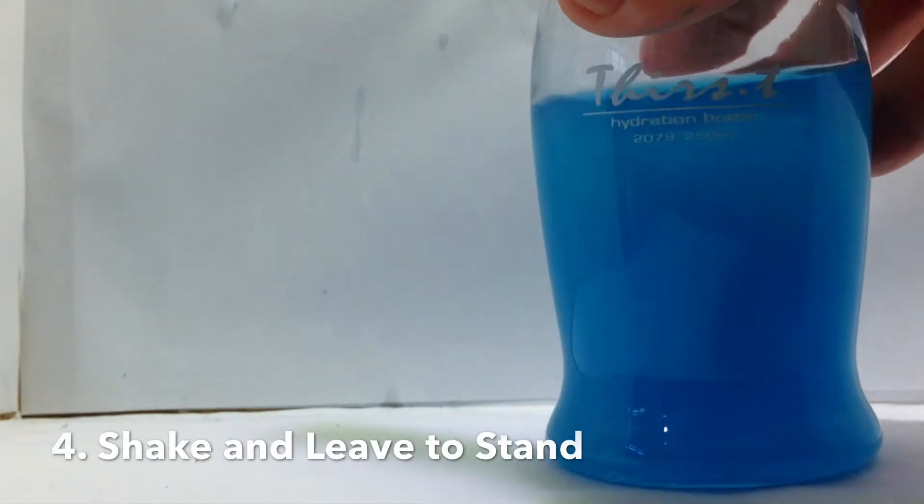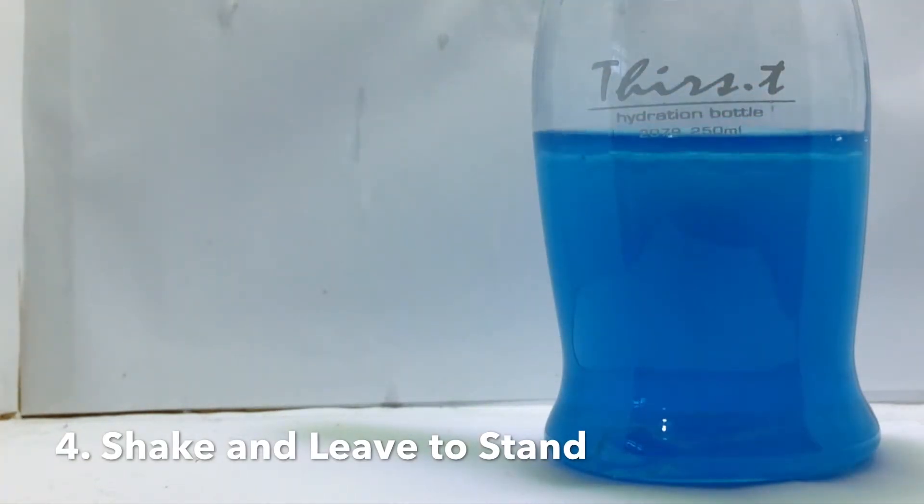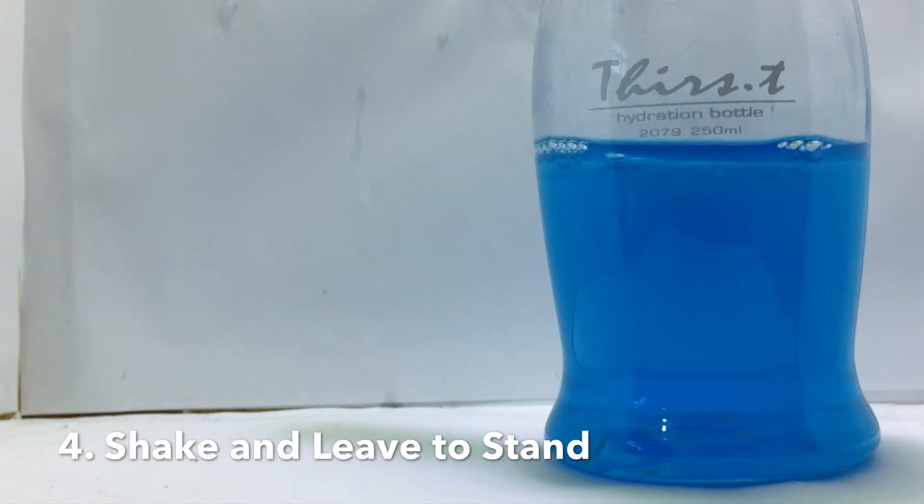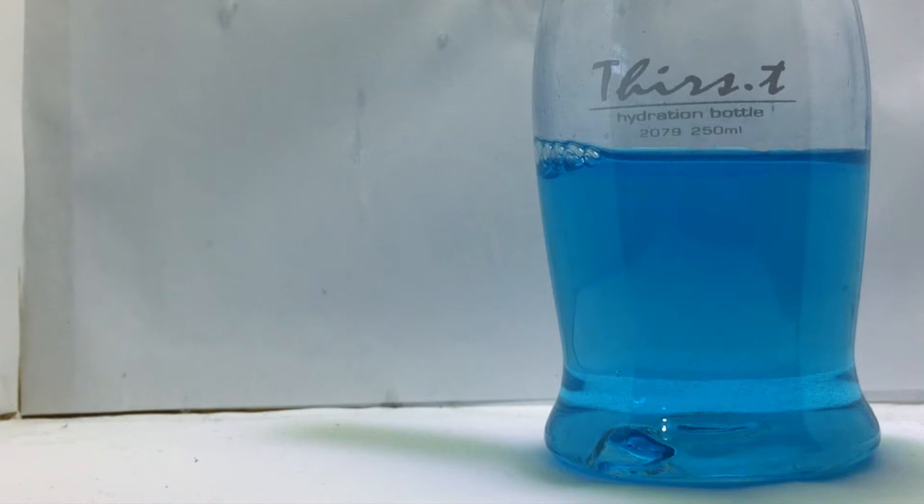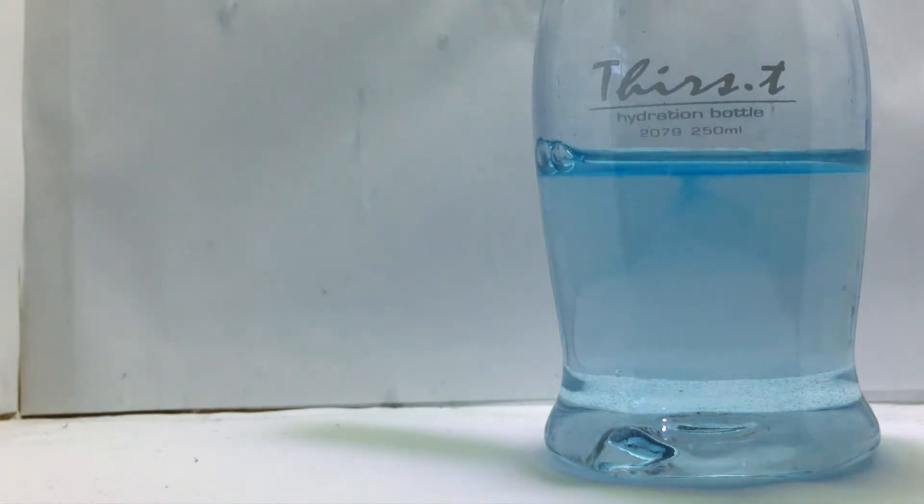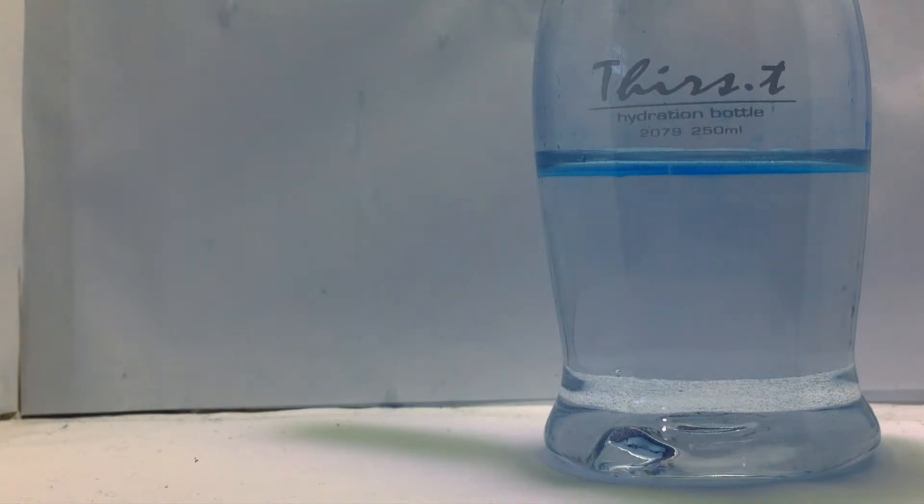Give the solution a final shake and leave it to stand. You'll find that the blue color disappears. To restore the blue color, just give the solution another good shake.